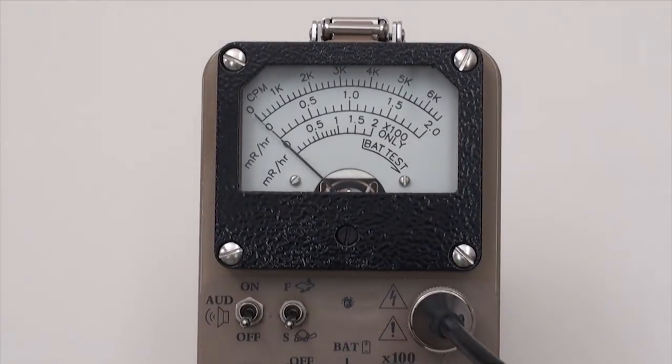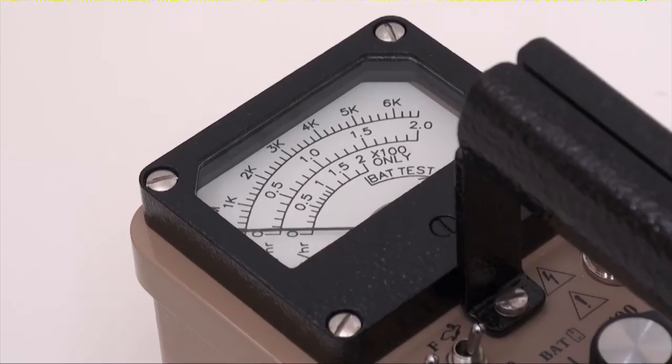To turn off the instrument, simply maneuver the rotary switch to the off position.